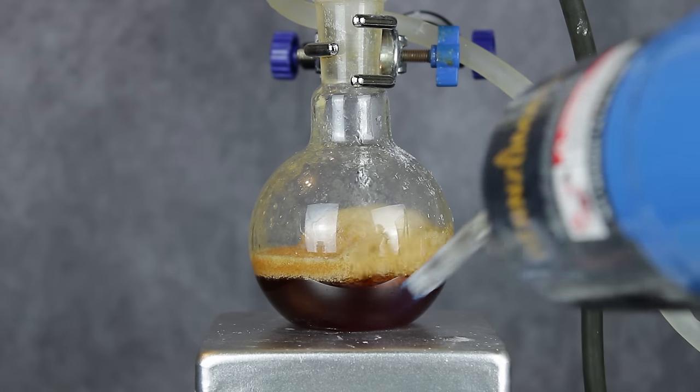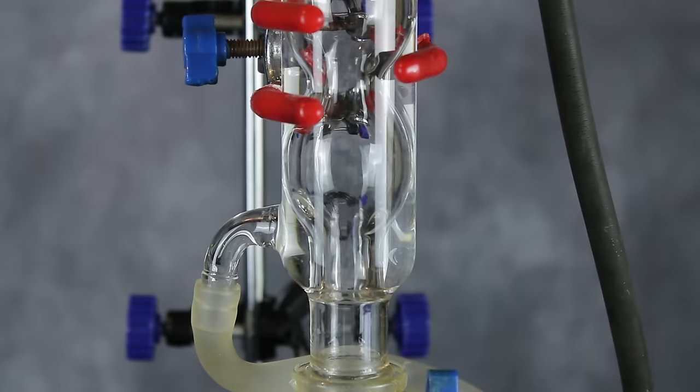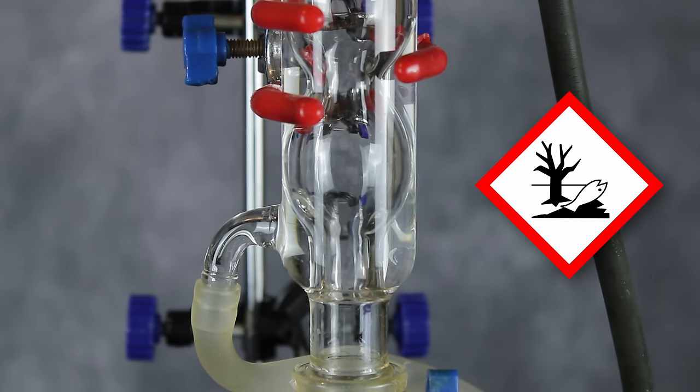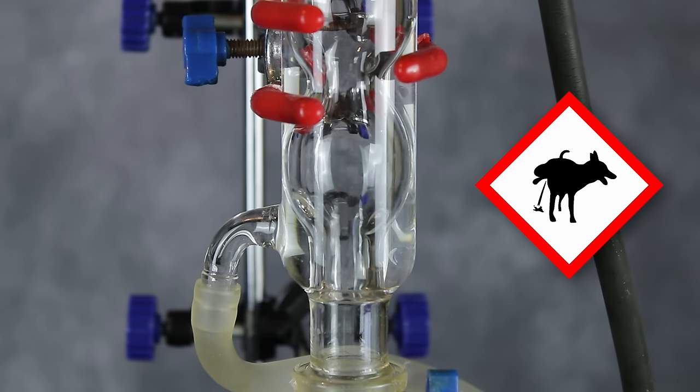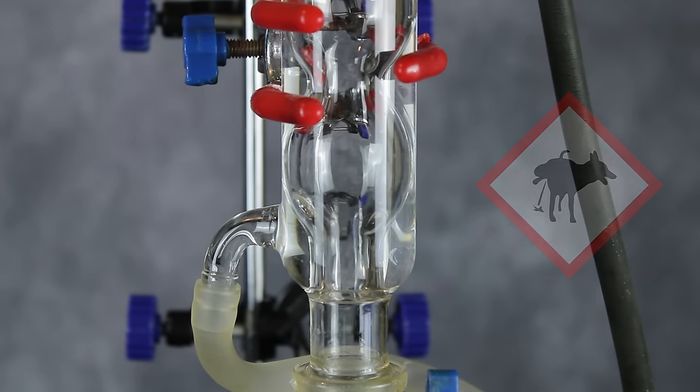Around this time, the strong odor of tert-butylamine became more and more pronounced. Like most alkyl amines, this stuff has an intense ammonia-like odor. Some people say the smell is fish-like, but I personally found it to be more akin to fresh animal urine. Certainly unpleasant, but I have smelled worse.